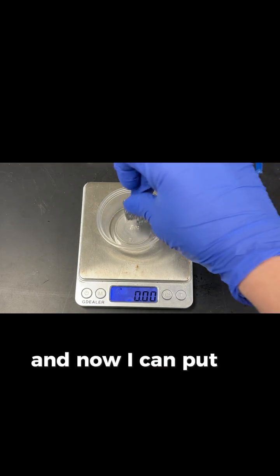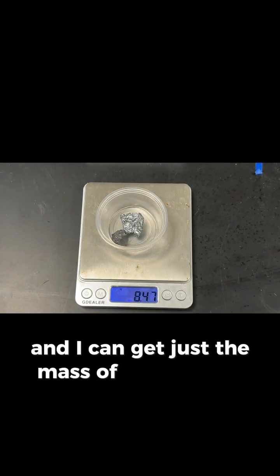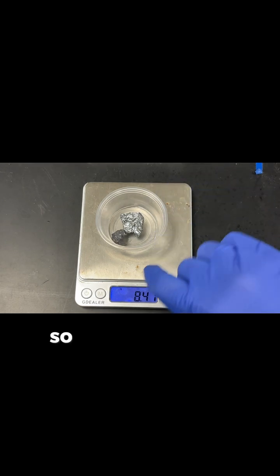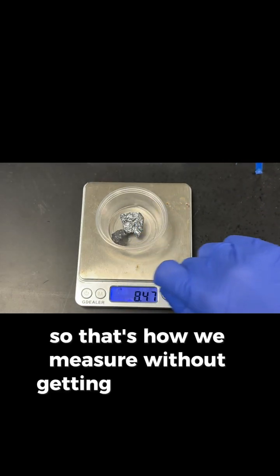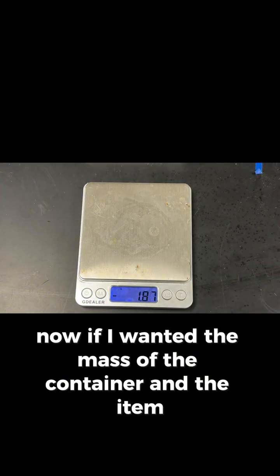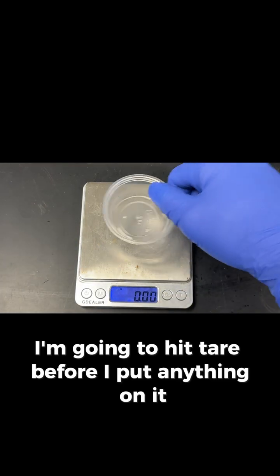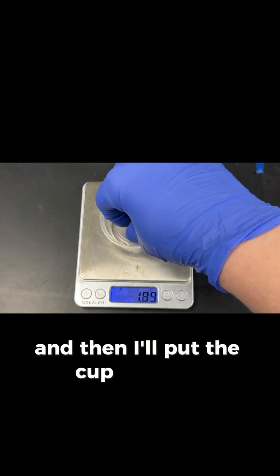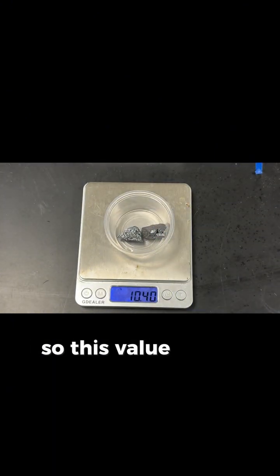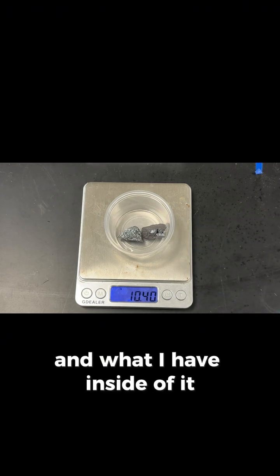And now I can put in what I'm measuring, and I can get just the mass of what I have in the cup. So that's how we measure without getting the mass of the container. Now, if I wanted the mass of the container and the item, I'm going to hit tare before I put anything on it, and then I'll put the cup and the container. So this value is the value now with the cup and what I have inside of it.